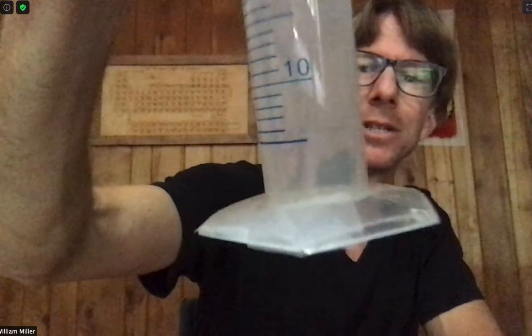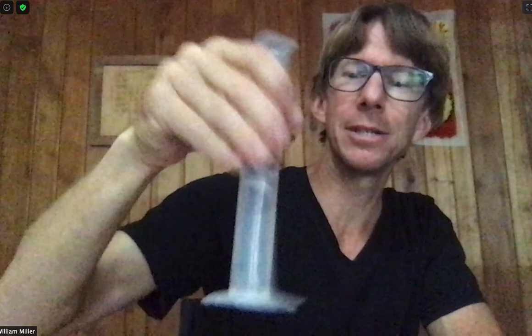Which I understand. This is actually dissolving pretty quickly. I've still got a little bit of salt there. You can still see where I repaired the base of my graduated cylinder with some scotch tape — helps it sit more evenly. All we're going for is to have all the sodium chloride dissolved before we add the rest of our water. This is real time — feel free to skip ahead to the end, because all I'm going to do is wait for it to dissolve and try to see it in my bifocals.